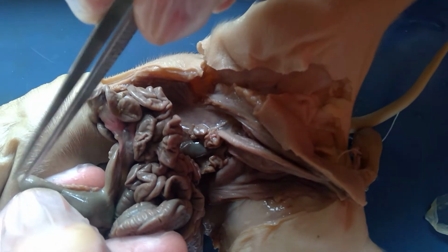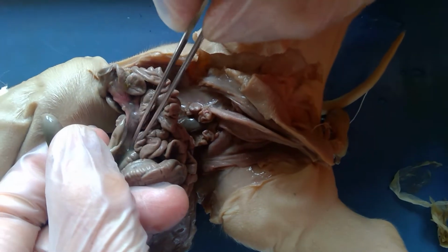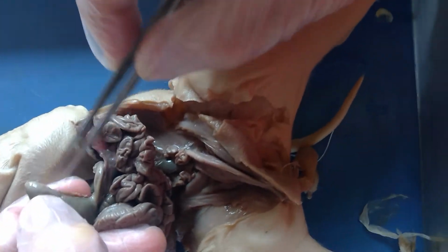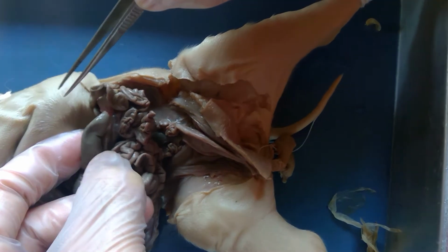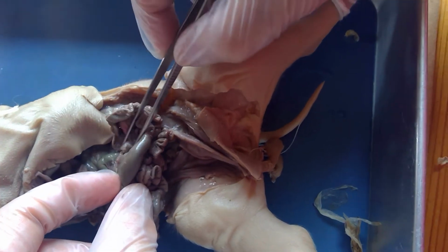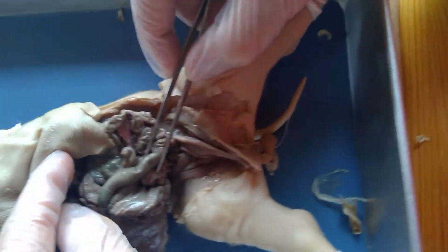But again, it has this dead end over here. It's kind of like a cul-de-sac. And what we have instead of that is the appendix. Now the hypothesis as to why we have that is because we don't need this extra bit of our large intestine, because we have been cooking our food, and we have a different type of diet than they do. So our body doesn't waste its time building a big long cecum.